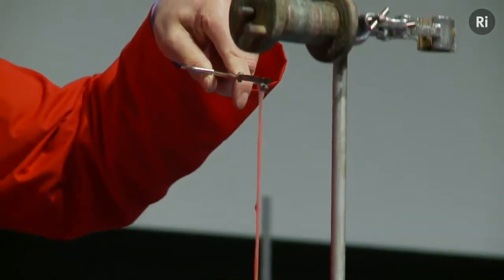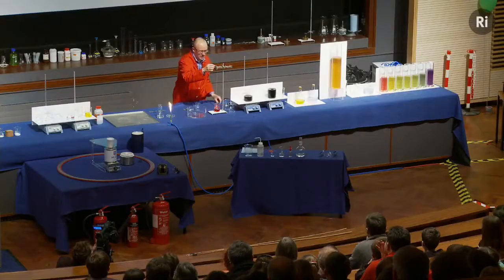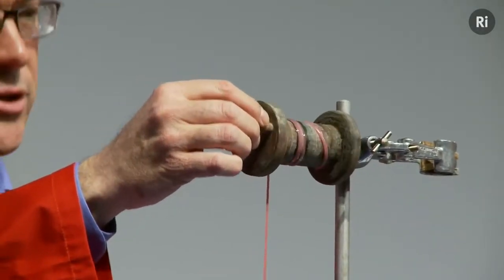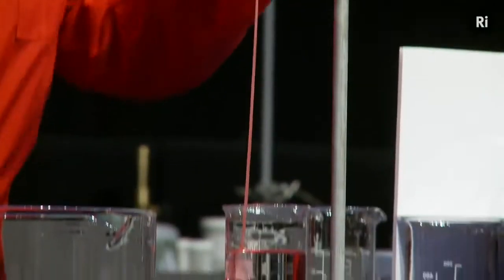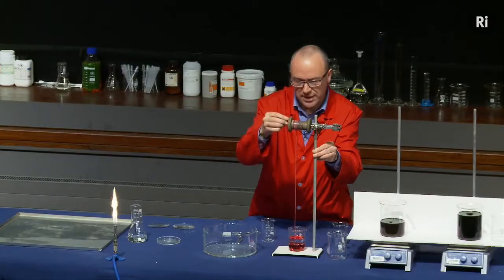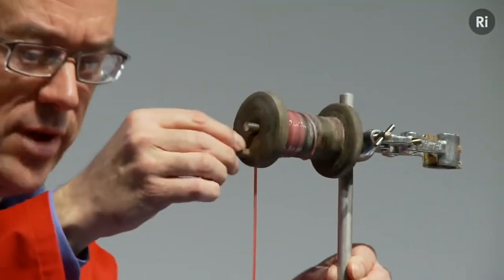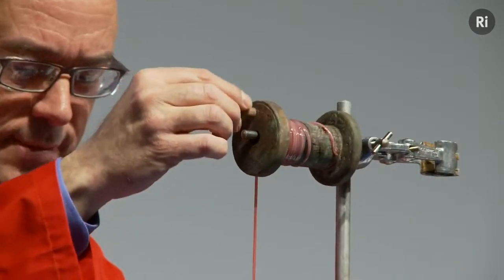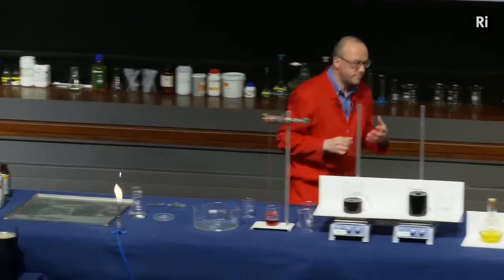So if I'm careful, as I wind, I'm pulling up this material and it allows the two liquids to meet again and it forms more of this material. And this substance that's being formed is actually nylon. So we're making nylon as I speak. And if I'm careful, I'd be able to just keep on turning this and making this long thread of nylon, at least until we run out of solutions. Okay, so that's an example then of a chemical reaction that involves a change of state.